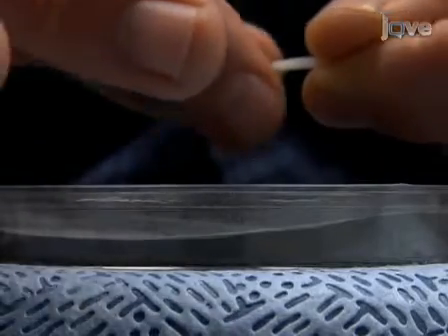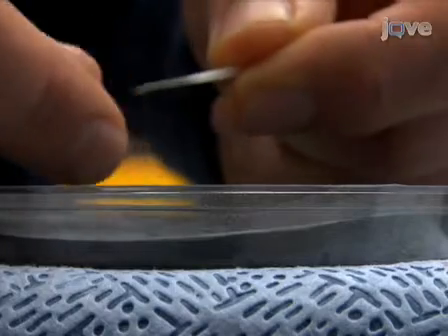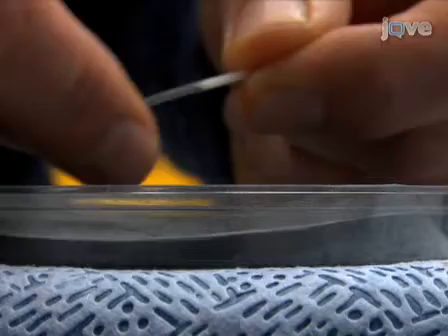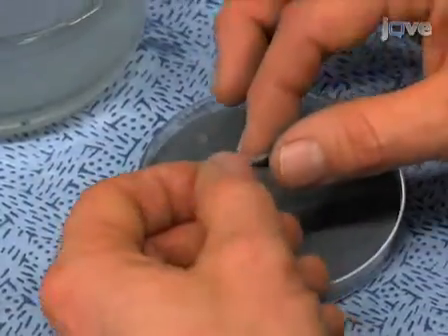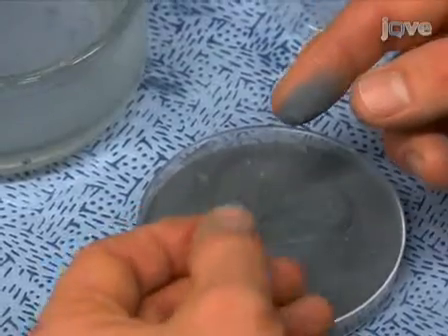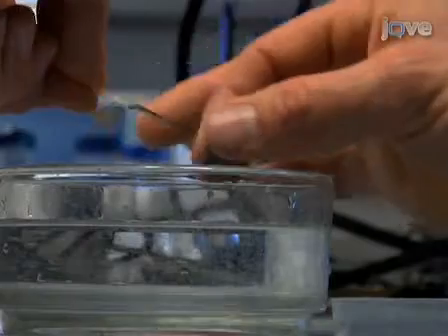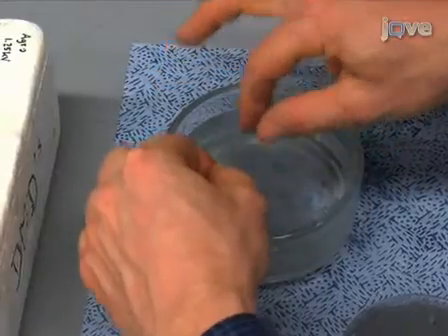While performing this technique, it is critical to use the correct amount of pressure that will ensure permeabilization of the cuticle without damaging the epidermal layer. One should also work quickly because as the frozen hypocotyl thaws, it becomes flaccid and hard to manage. To remove most of the adhering carborundum, the abraded hypocotyl is dipped and then stored in ice water while the remaining hypocotyls are being prepared.